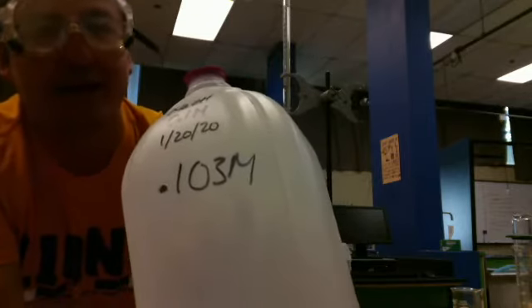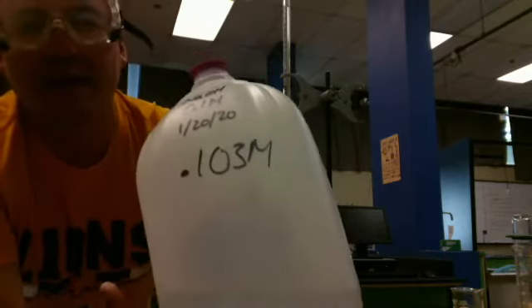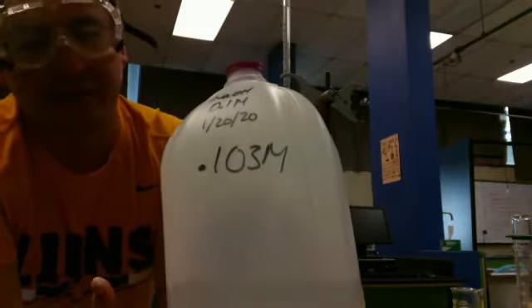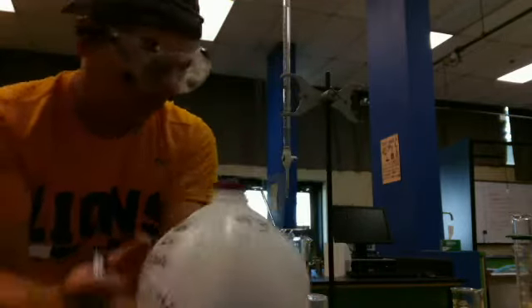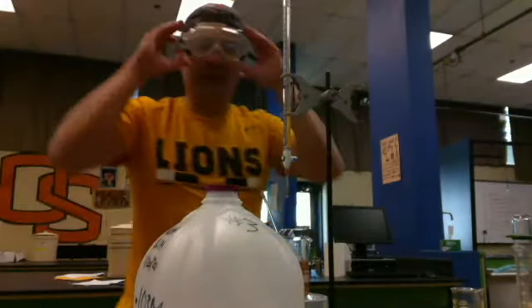So I knew it was approximately 0.1. Now I know for certain, with precision, it's 0.103 molar. And again, this whole process to find that concentration, when you're finding concentration, that's called a titration. Just like when you're finding the mass of something, we call it weighing. Well, when we find the concentration, we say we're titrating. So that's the word. Hopefully, that's not too long. My glasses are getting foggy. I guess I'm getting excited about chemistry.